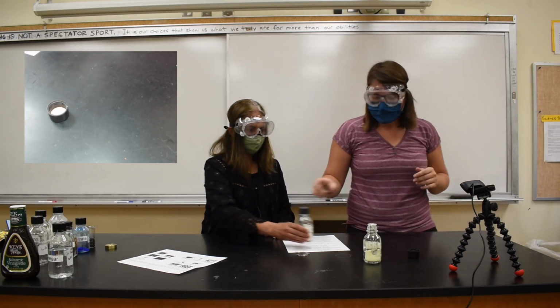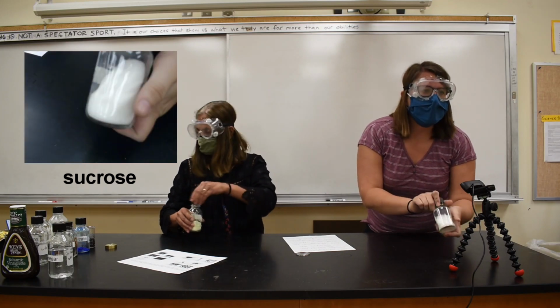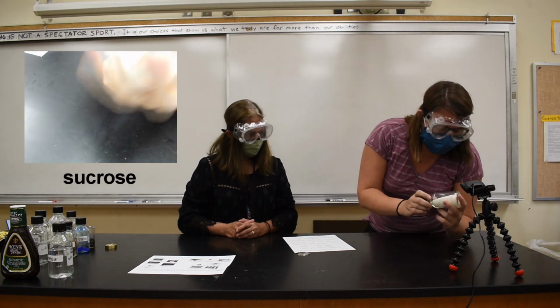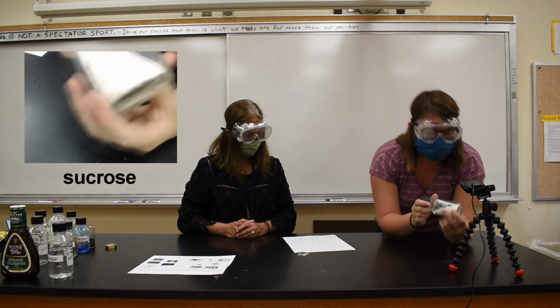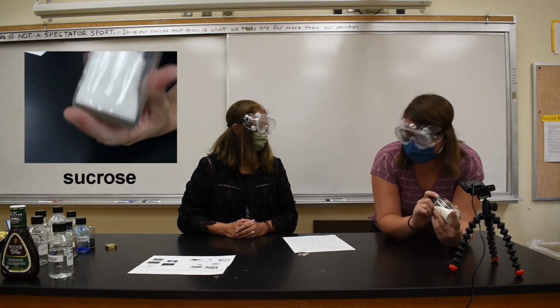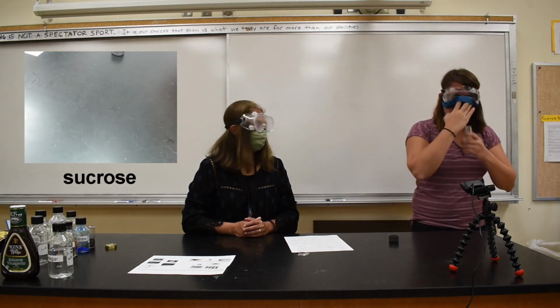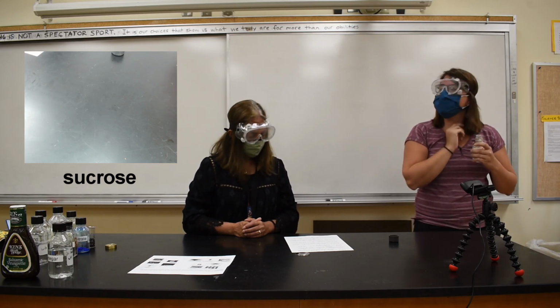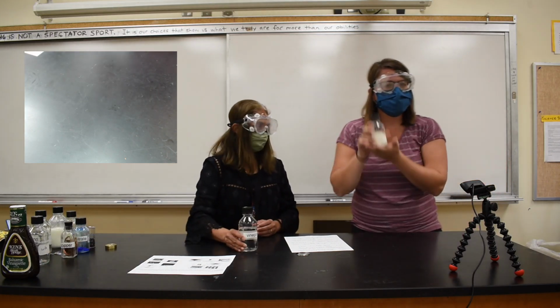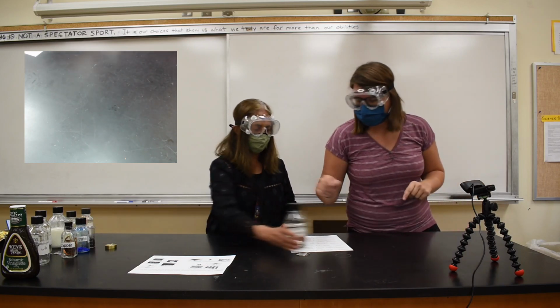And our next one is sucrose. It's something you're probably familiar with. You might have it in your cupboard at home. It's not so much a powder like sulfur was. It's almost like little grains, but it's white, very small grains, solid. And then we're going to figure out the smell. Smells almost sweet. It would probably taste sweet if I tasted it, but I'm not going to do that since this is a chemical demonstration and we don't put things from lab in our mouth. Bad idea.